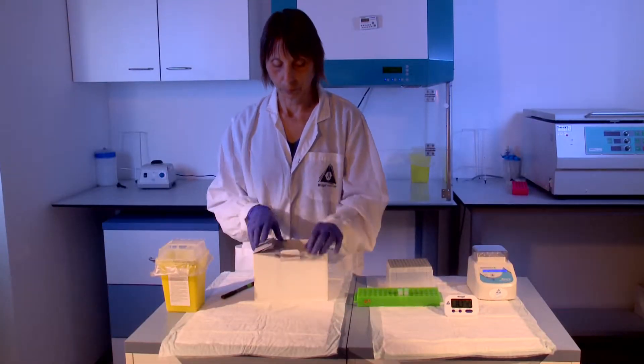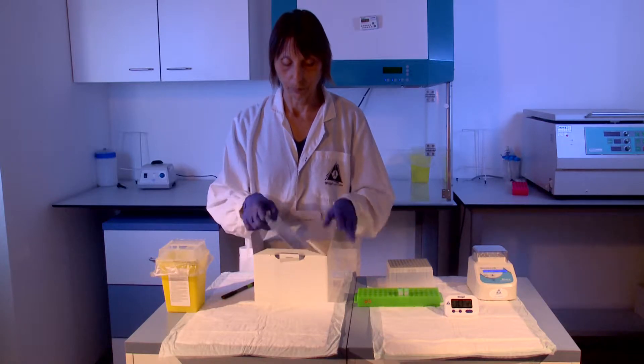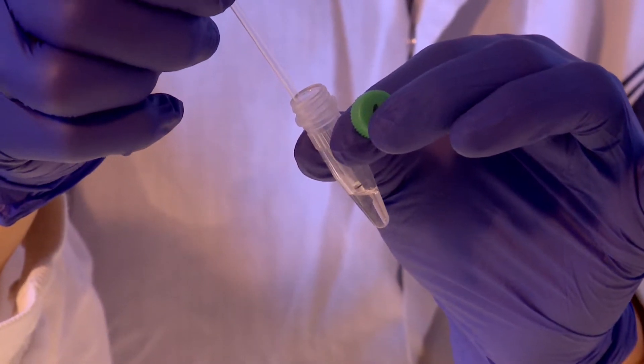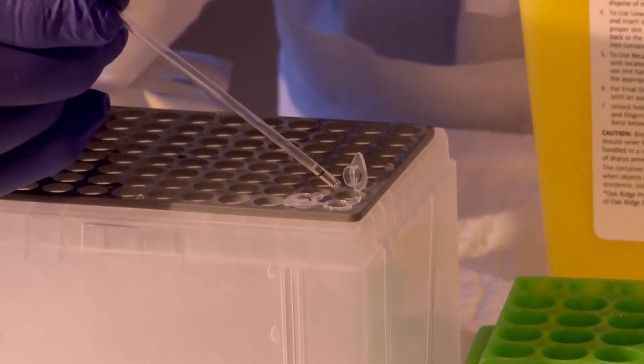We will demonstrate the method of performing a PC-RUN molecular detection reaction using a heat block and DNA extracted by the PC-RUN DNA rapid extraction method.